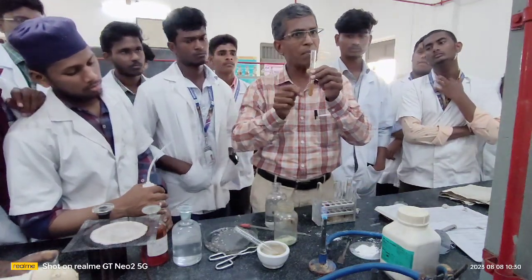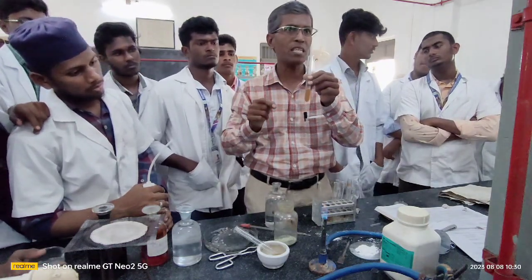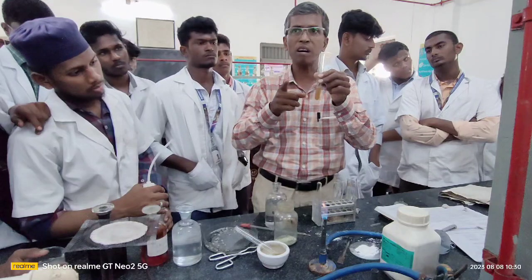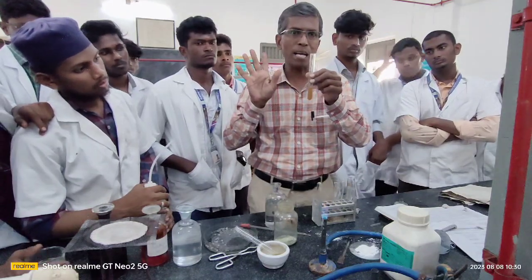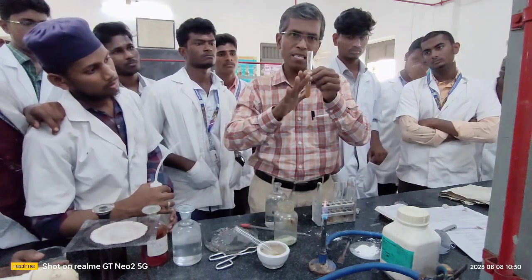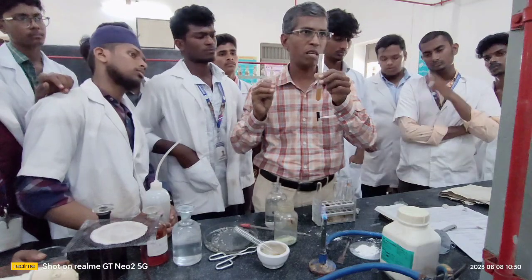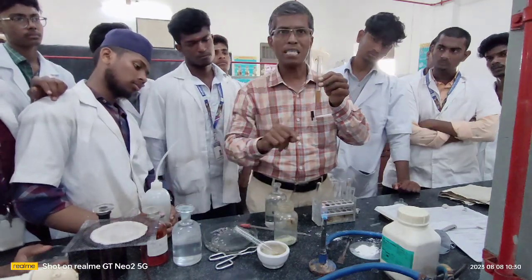What is the reason behind the formation of the blue colored solution or green colored solution? I told you the complex is formed. Everything I have explained. You please proceed and continue in the same manner with respect to the organic compound you have in your hand. Okay? Pass it.